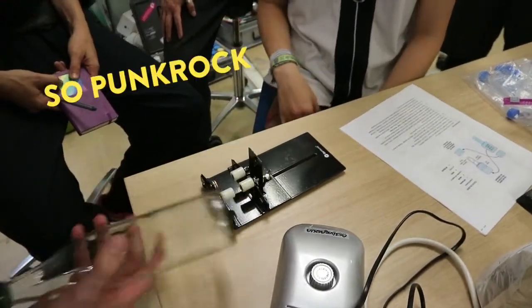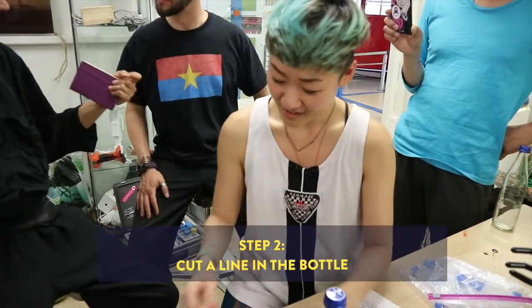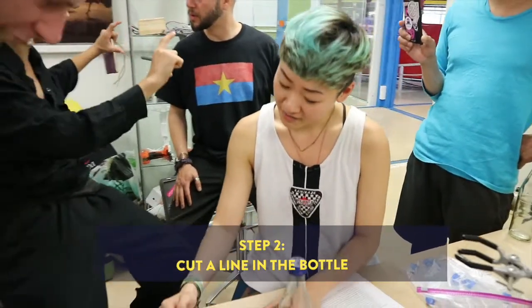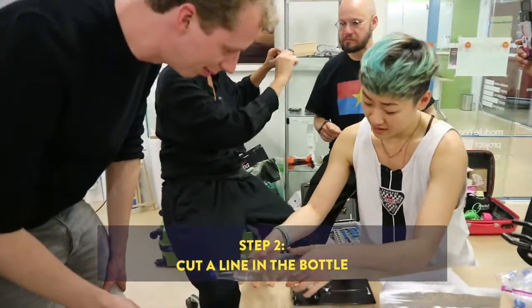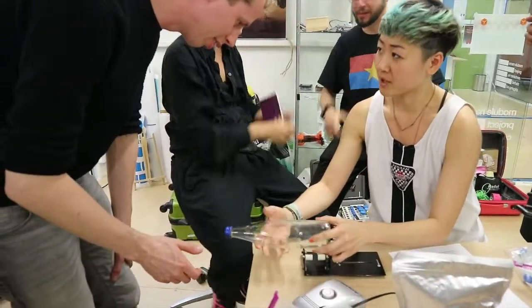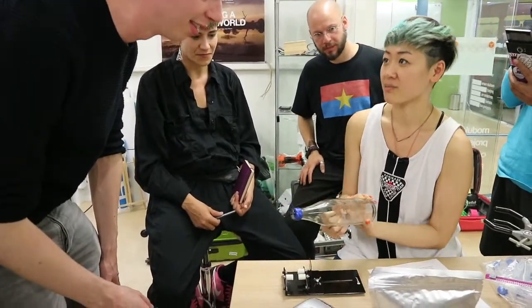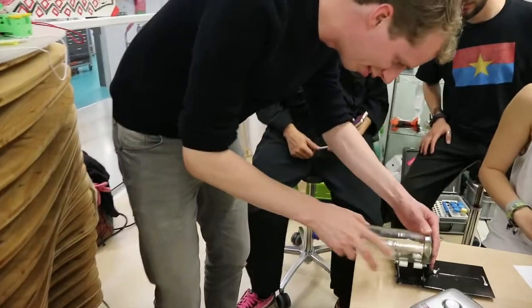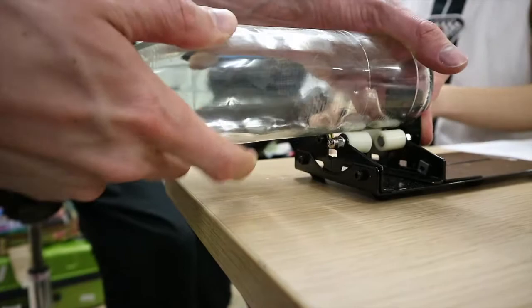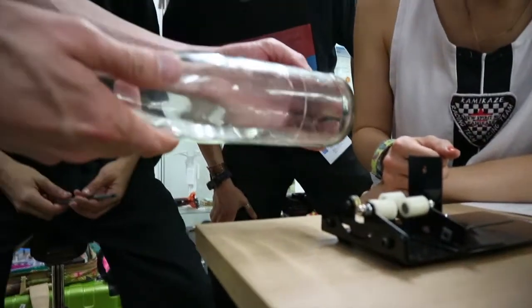Have you used this before? No. So punk rock. There's a blade right here — it's okay to touch it, it's fine. What you're going to do is just rotate the bottle 360 degrees and make a line, basically. Try to make it as straight as possible so one end should meet the other end. Sounds doable. Right on. Perfect.